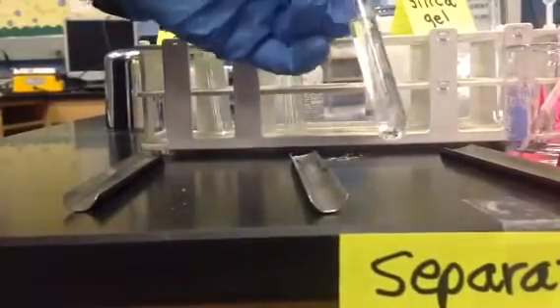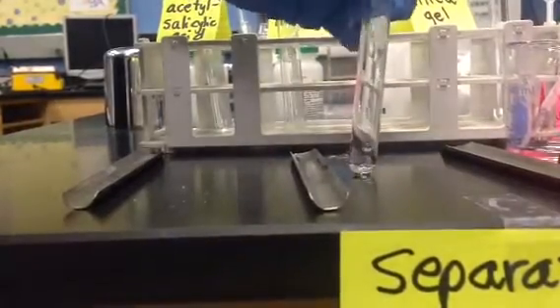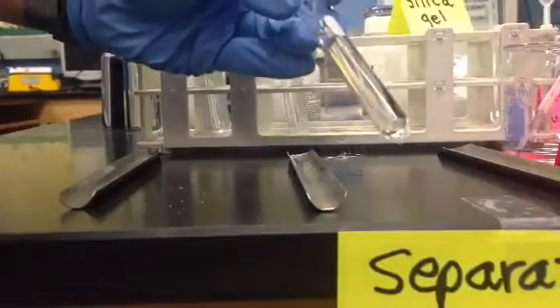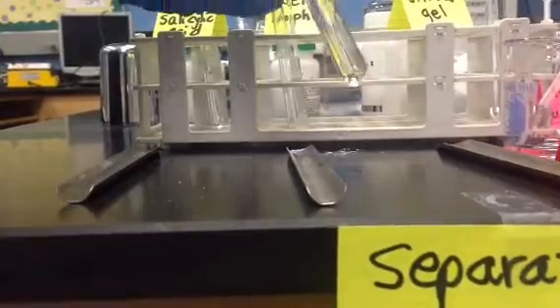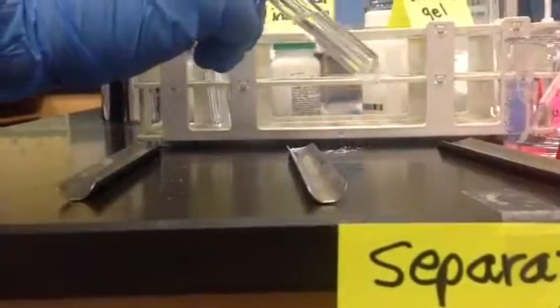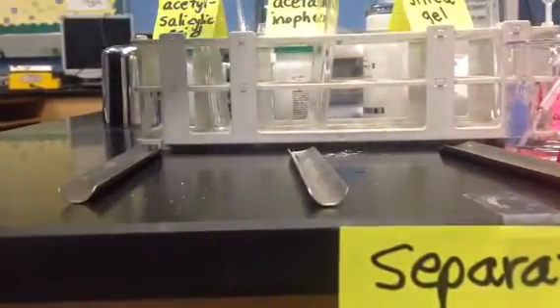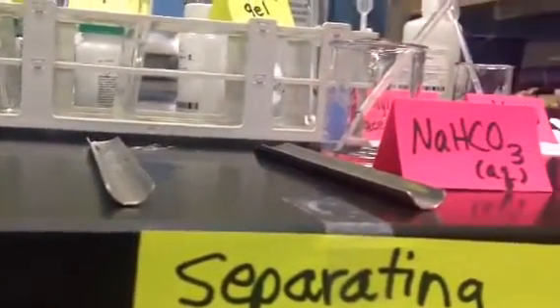But definitely when I pull my stirring rod out, that's it. These are pretty much bubbles. Maybe a little bit of the solid, but it's definitely soluble. There's nothing on the bottom. It has a definite, most of it's gone, whereas when you look at this, you can see all that solid still left over, not soluble. So acetaminophen is not soluble in the sodium bicarbonate. Acetylsalicylic acid is soluble in the sodium bicarbonate.